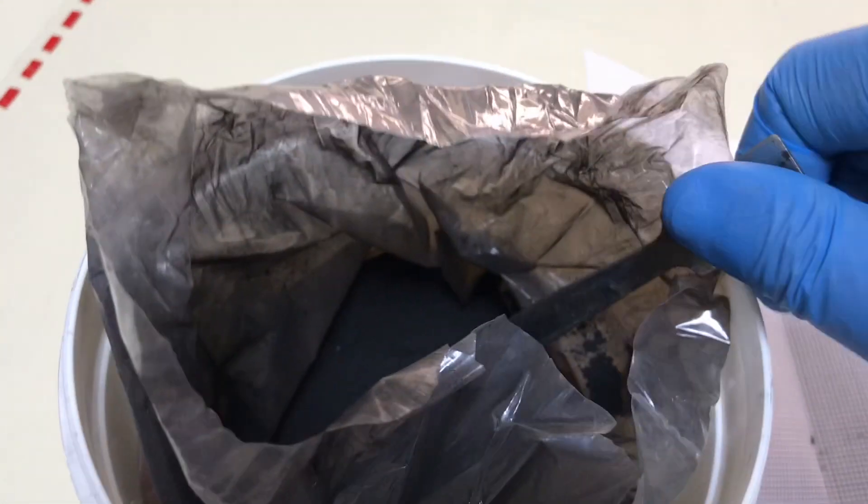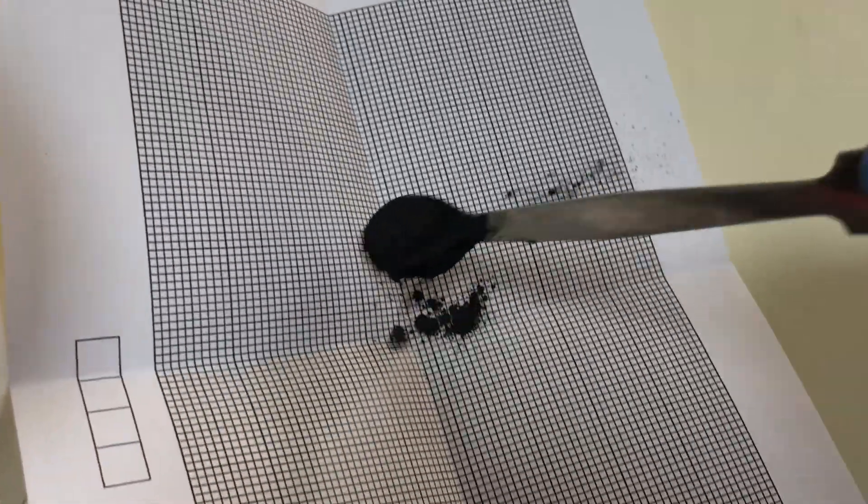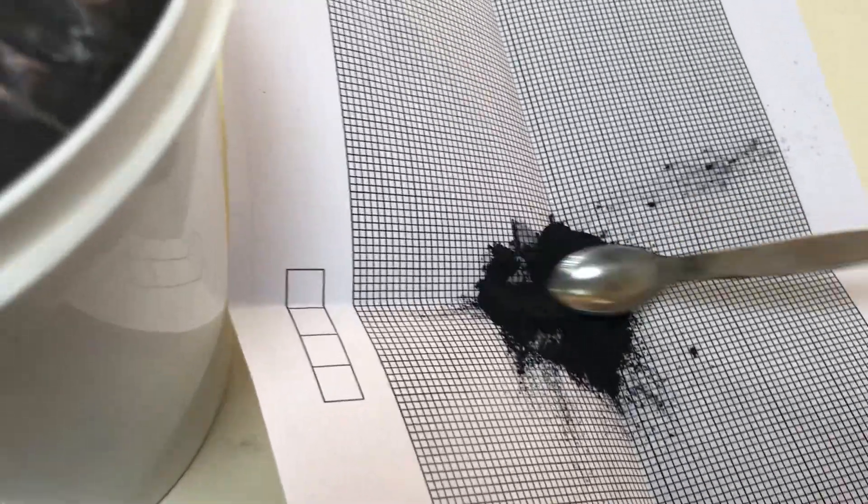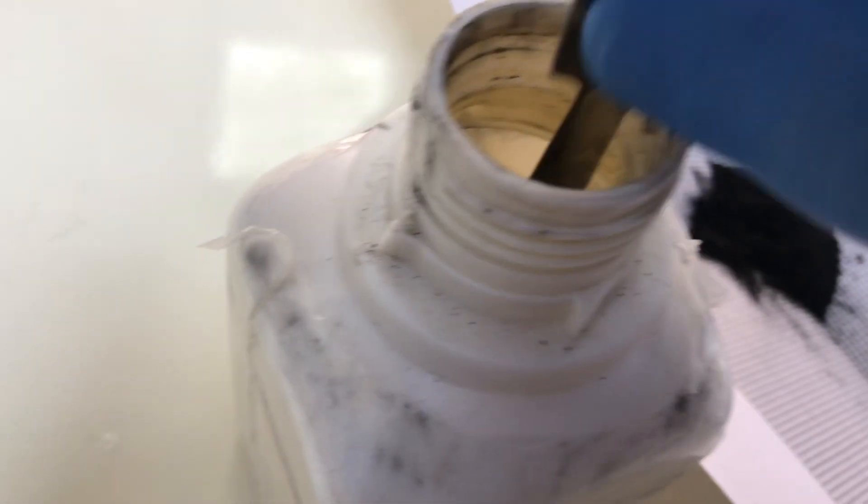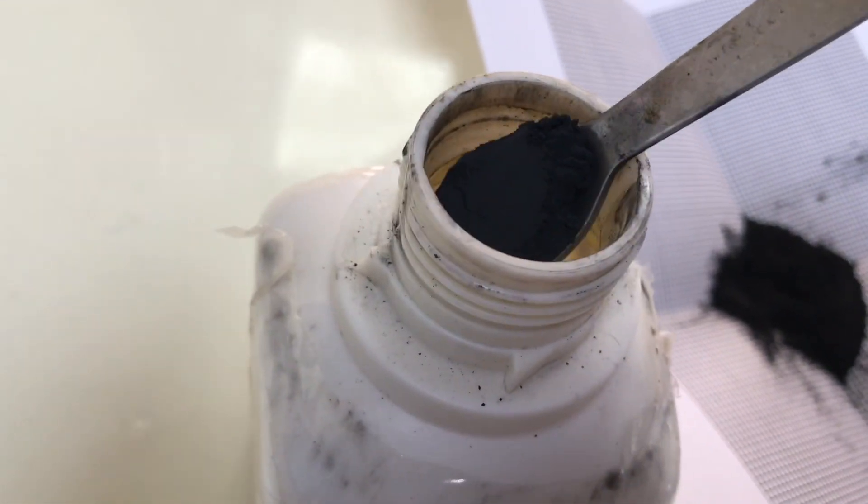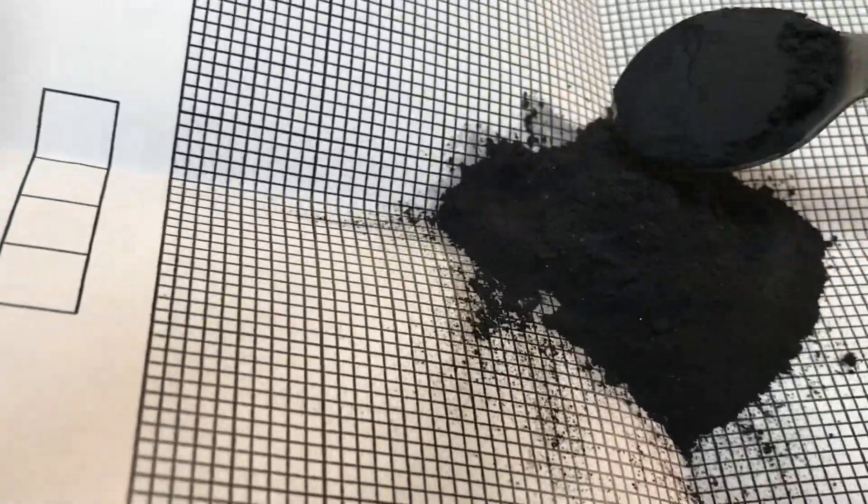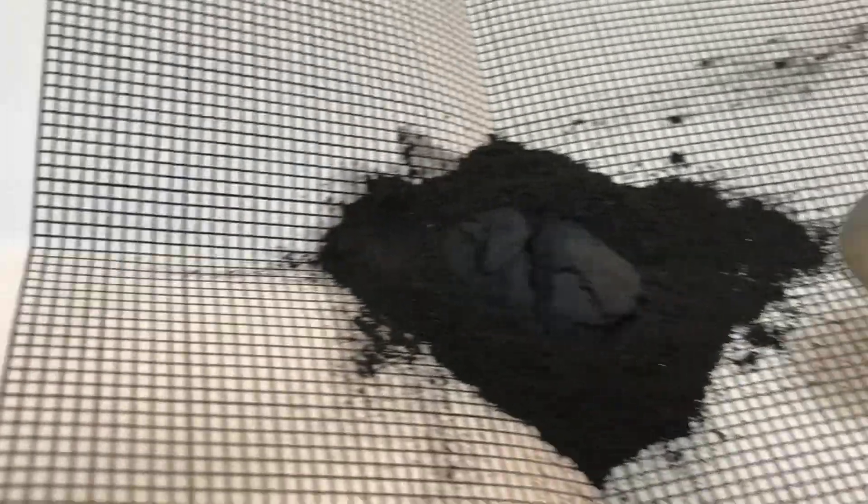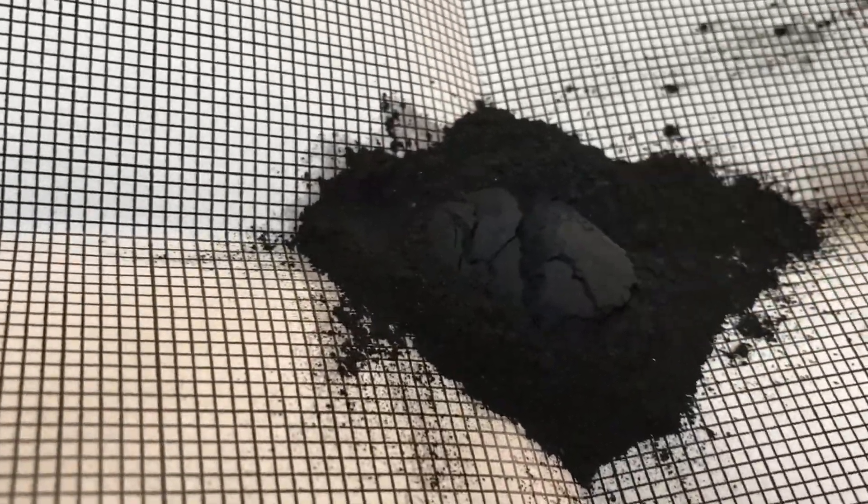So here we are. We're going to try that again and we're going to have a nice spoonful of the carbon. So here we go. Put that in the middle. Okay. I've got a rather large boiling tube so I'm going to use two this time. Next in goes the copper 2 oxide. As you can see it is another black powder. I'm just going to zoom in on this just to show you. It's just a little subtle difference in the shades but it's pretty black.